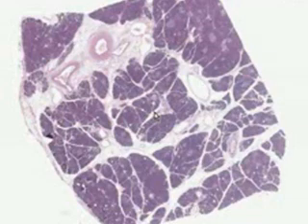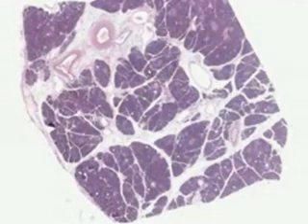The beautiful thing about the pancreas is that it is a classical exocrine gland. In fact, it could very often be confused with the parotid gland, except for the fact that it has these little white islands inside of it called the islets of Langerhans. Otherwise, on an average day, I could believe it was a salivary gland with 100% serous acini like the parotid. But let's go a little bit deeper and review exocrine in general.